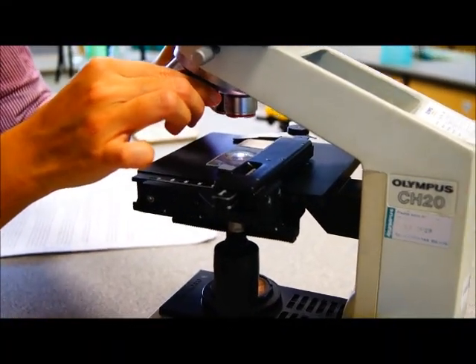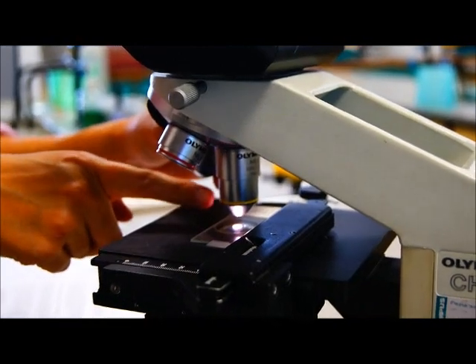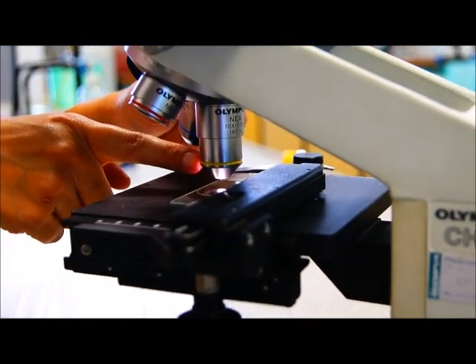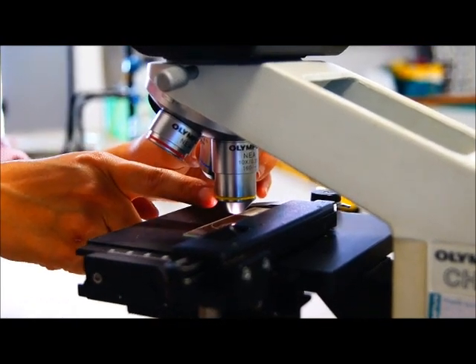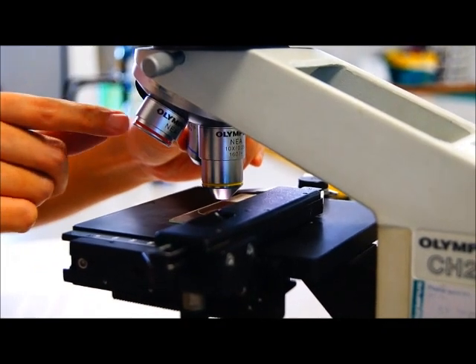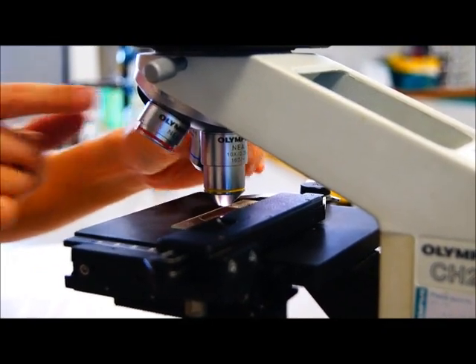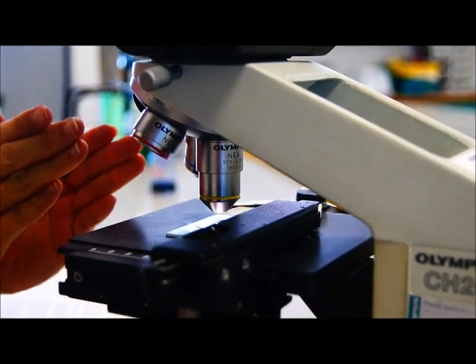So when you increase the objective, basically you just turn the nose piece sideways. Now the yellow one is actually 10 times magnification, it's the next highest objective. Don't skip one objective. Go to the very next one. And you will be able to feel that clipping feeling, that click when you get the objective in line.